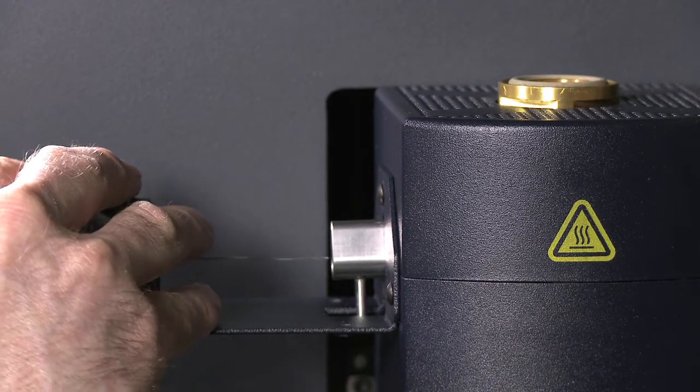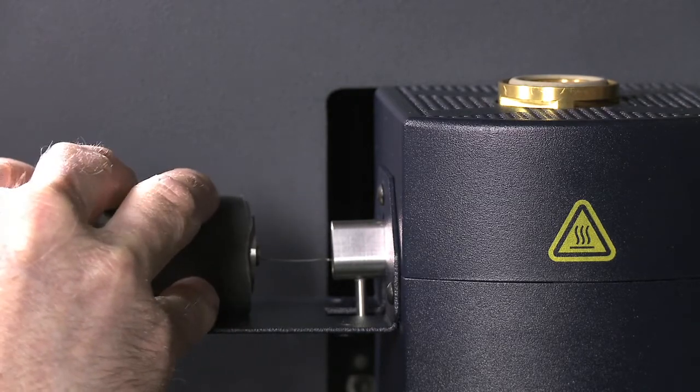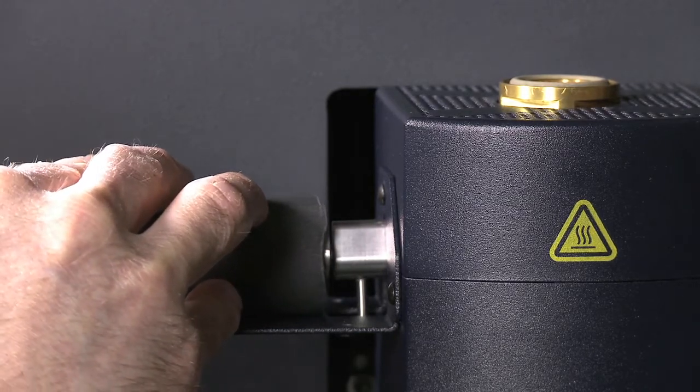Carefully insert the capillary into the hole in the adapter, and push it into the furnace until the end of the heated transfer line makes contact with the adapter.